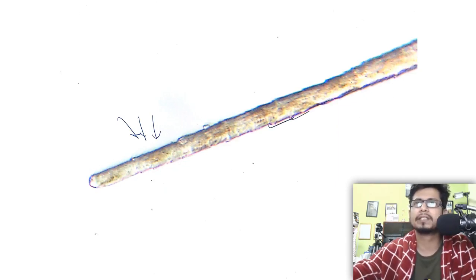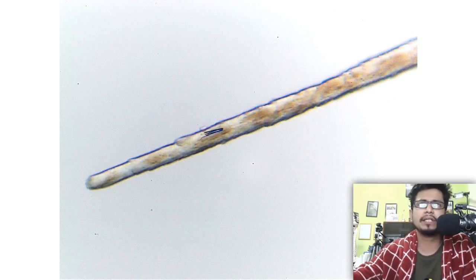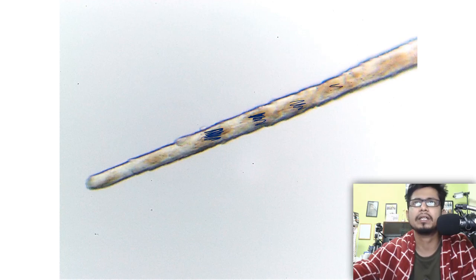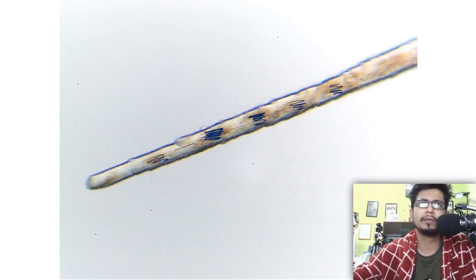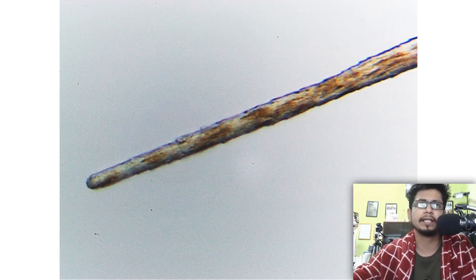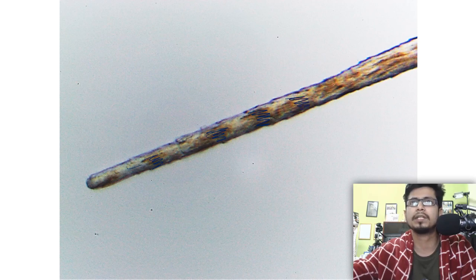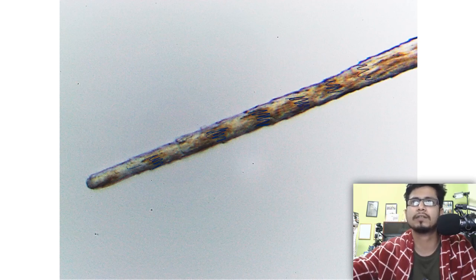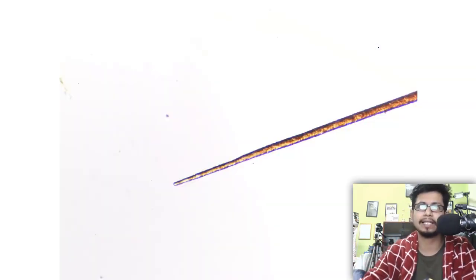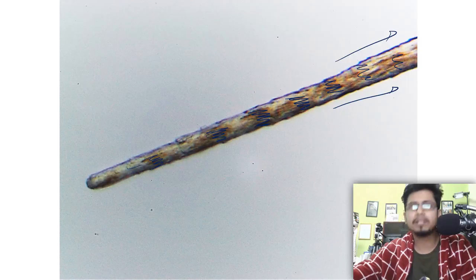This image shows much better contrasting, where you can see multiple breaks. In another picture you can see that some proteins are much more concentrated in a few locations of the hair, and are equidistantly present throughout the hair at the terminal side. These darker regions are components of the protein structures that hold the structure of the hair, becoming darker and darker as we go backwards in the hairline.